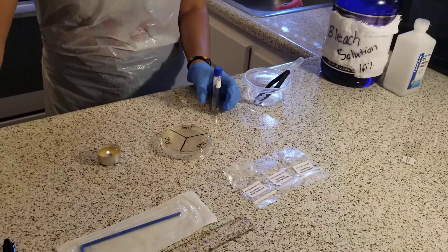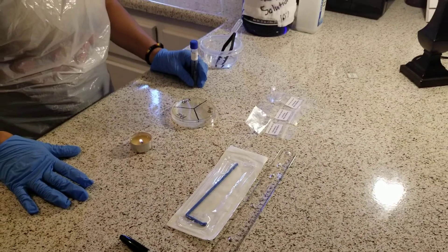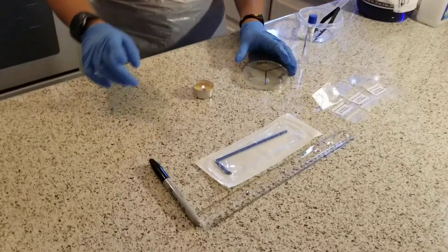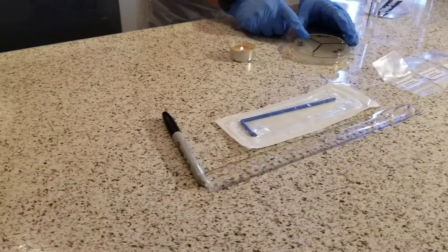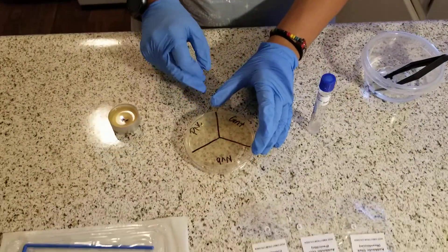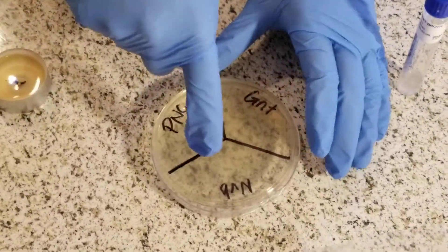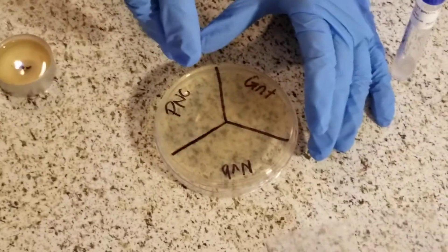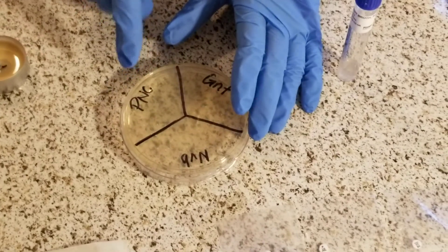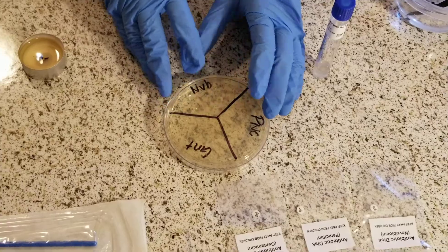I've cleaned my surface with 10% diluted bleach, and I have gathered all the materials listed for this experiment. I poured my agar plate yesterday to prepare for today. With a permanent marker, I've created three sections labeled with the corresponding antibiotic: NVB stands for novobiocin, PNC is for penicillin, and GNT is for gentamicin.